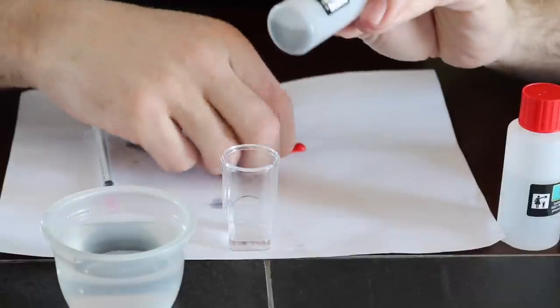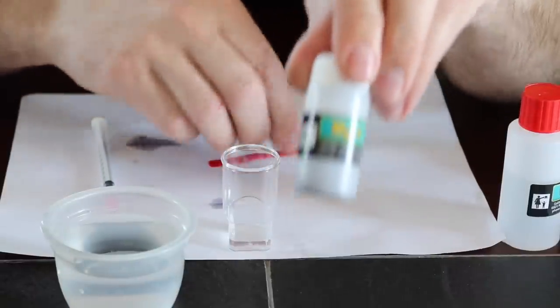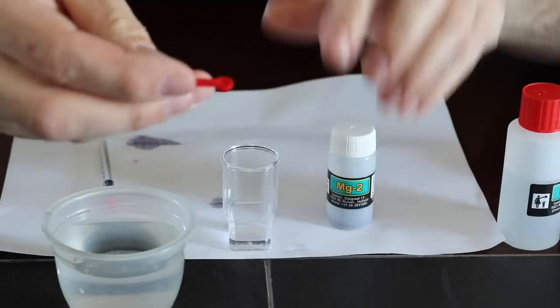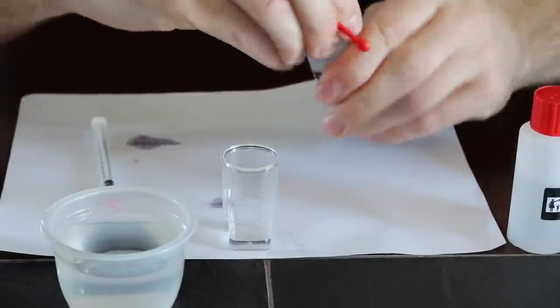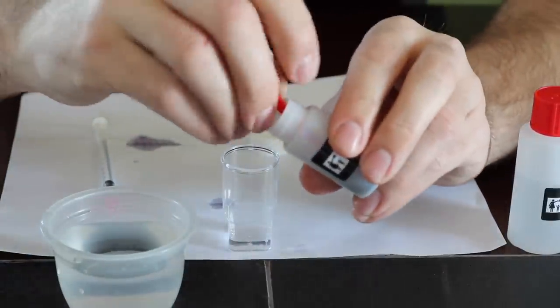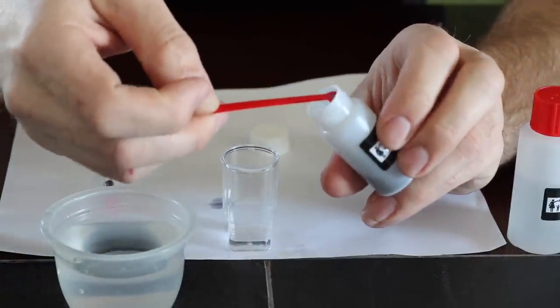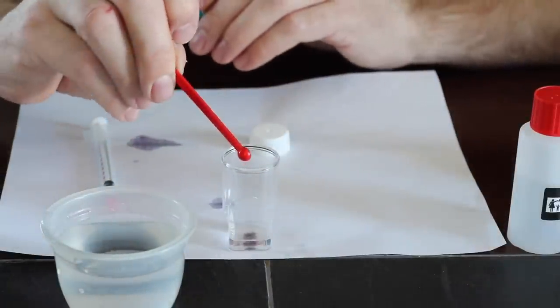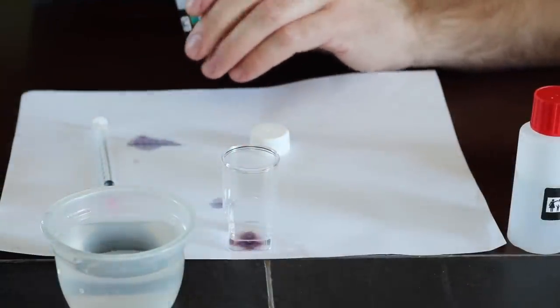So what you need to do now is you've got to take the MG2 and you've got to take the little red spoon that comes with it and just fill it up level. So we'll open that up and make sure it's level. So you guys can see it's perfectly level. You're going to put that into your test vial just like that and then you're going to put that to the side.